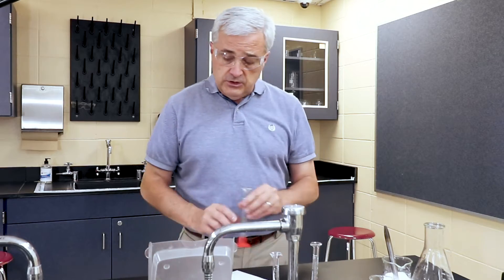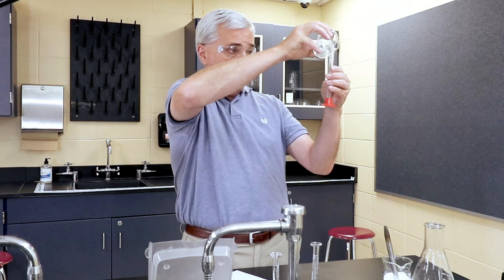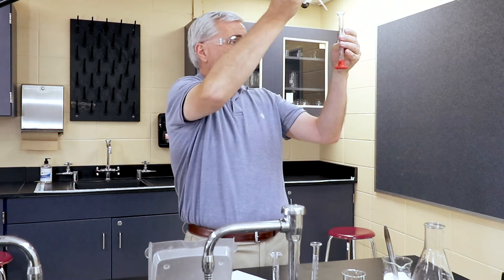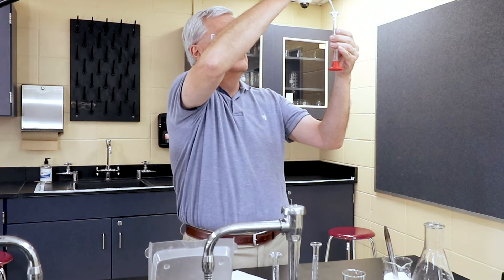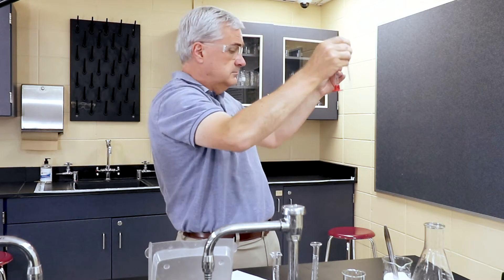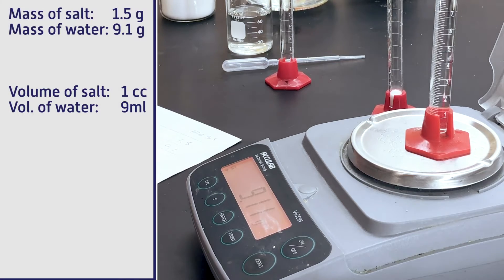Into graduated cylinder two, we're going to put that on the scale and zero it. So we're going to put into this nine milliliters of water. And I have a pipette so I can make that as accurate as I can, very accurate. Nine milliliters. Reading a liquid from the bottom of the meniscus, I'm going to put a couple more drops in until I get that meniscus up to the nine line. And that gives us a mass of 9.11, so we'll call it 9.1. And that is nine milliliters.